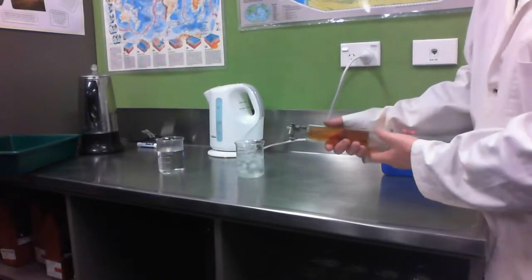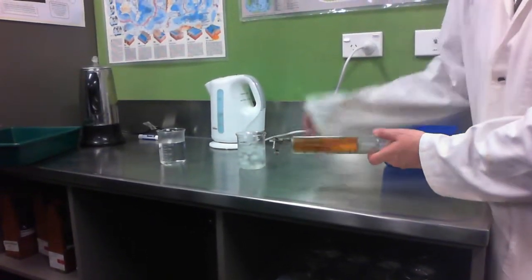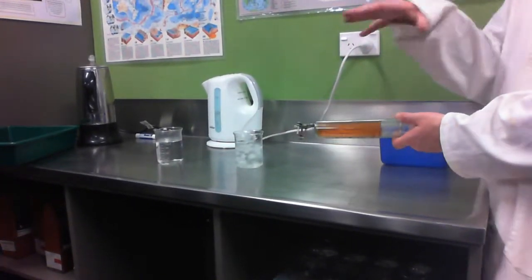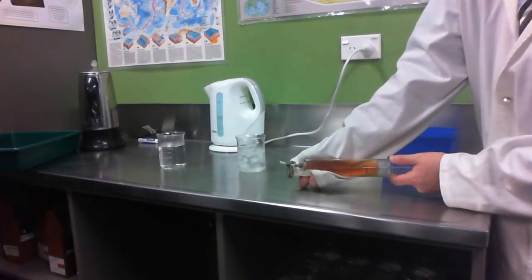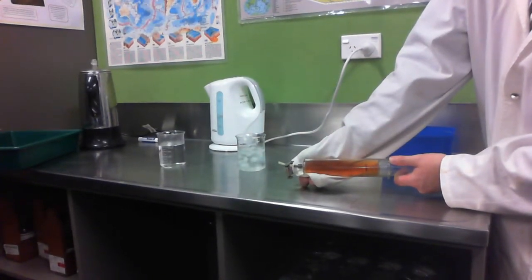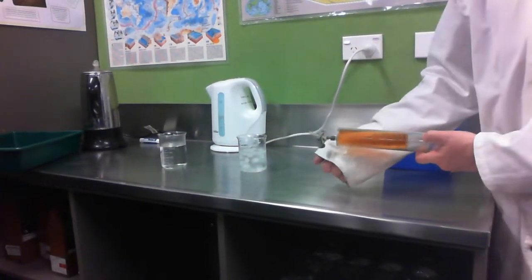The other thing I could do, without actually opening the syringe because it's a toxic gas, is I could decrease the pressure, and of course that'll spread the particles out, so it'll initially go paler, and then see if it then darkens up a little bit. So let's see if that's what happens. So again it goes a bit paler. I think it was a bit hard to see, wasn't it? It did actually technically go a little darker, but not a lot. So that's not a very good one for us to see with this particular equilibrium.